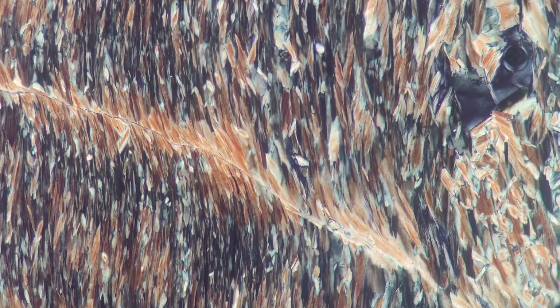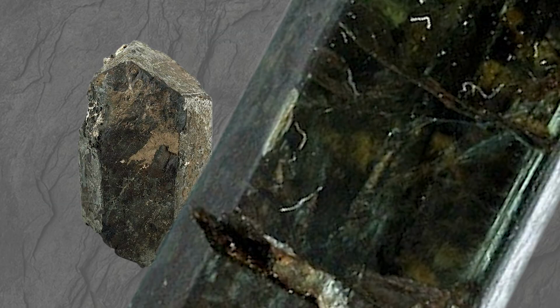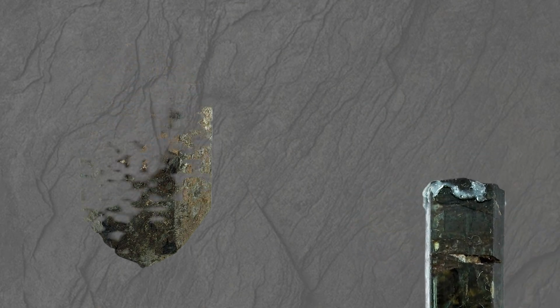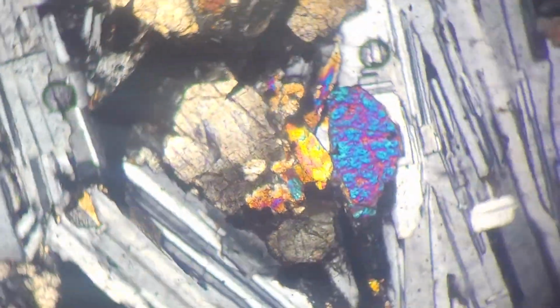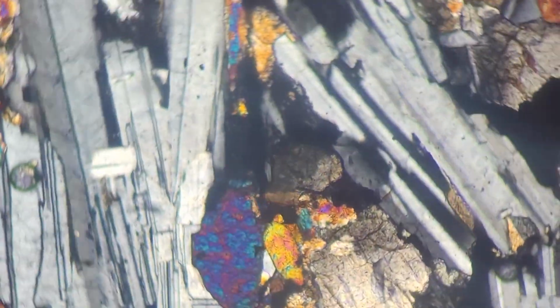There are over 5,000 different minerals, some of which look incredibly similar in rocks. I mean, clinopyroxenes and orthopyroxenes are often only different by a slightly greener tinge in clinopyroxenes. So how do we tell these minerals apart then? In mineralogy, we do this by creating a thin section of a mineral and viewing it under a petrographic microscope.